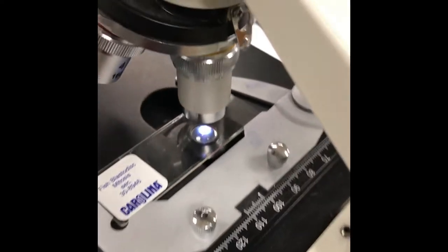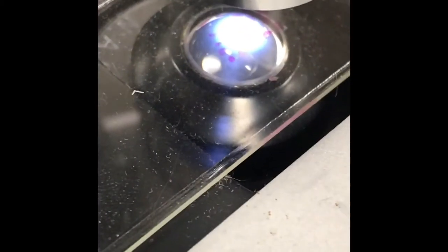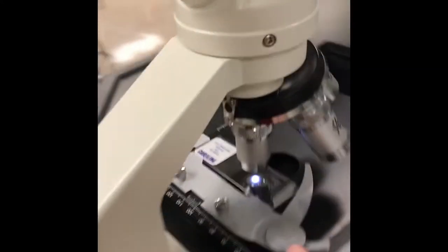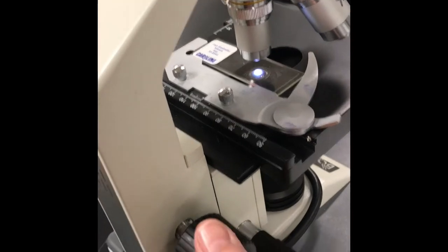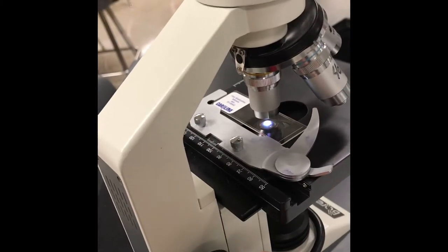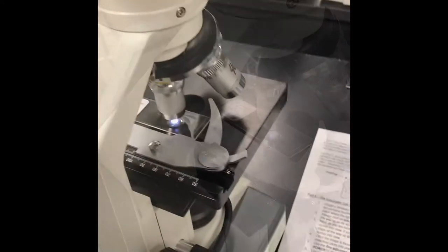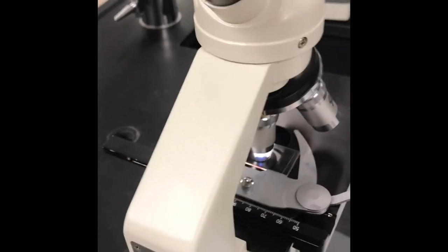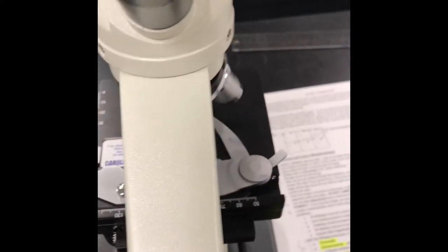Looks pretty good right there. See how I can see the circles, the little dots are right above that field of view. And now I'm going to only use, because I'm on 10x, I'm going to only use the coarse adjustment knob, this big knob, and I'm going to raise the stage up as I'm looking through until I can see something. Okay, so I found it on 10x or really it's 100 times. This is going to be really hard to do, but I'm going to try to hover my camera over the field of view. Don't draw anything from this, but I'm going to just show you what I see. Once you get it in focus, or once I get it in focus, you may want to push pause on the video, because it's going to keep going in and out. Hang on, there we go.